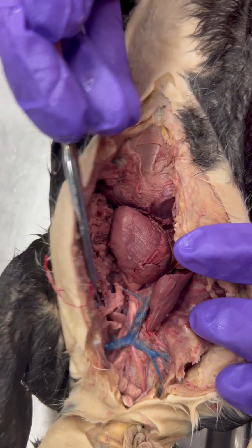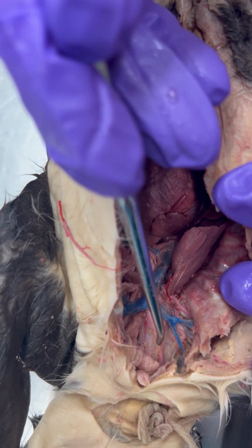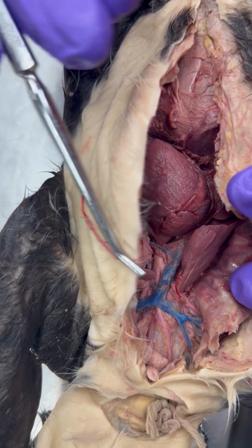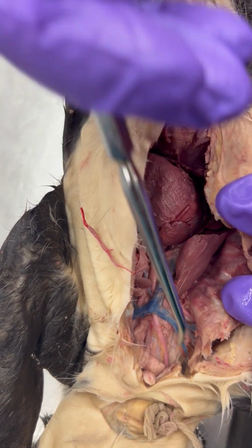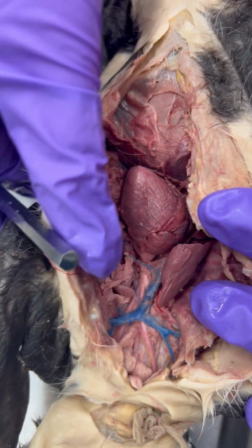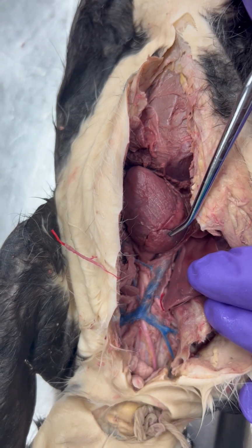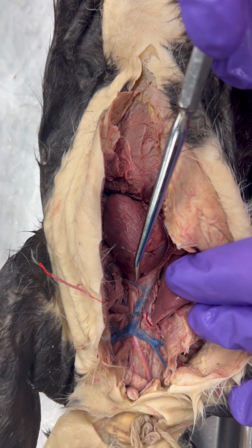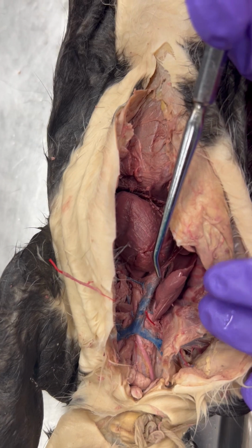So in order to get this visualization of these arteries and veins, I had to gently, using a blunt probe, pick away at the fascia to follow them and expose them. So just something to keep in mind and to be very careful of as you proceed. Of course, let us know if you have any questions, but this will take time to do it right. And if your specimen is not adequate, we can have you check somebody else's group and maybe work with them.